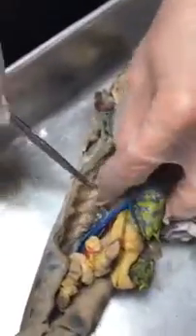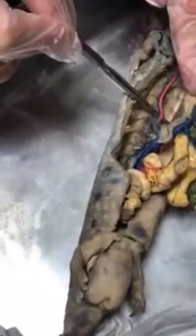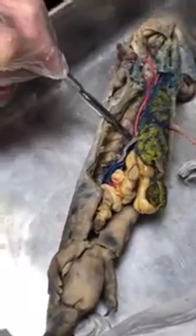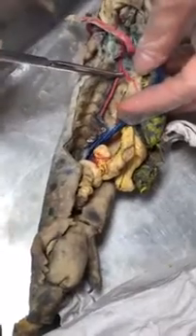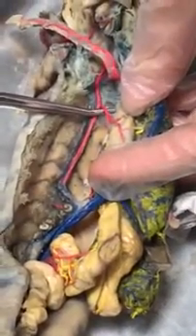Okay, dorsal aorta. And then around either side of the dorsal aorta, the 2 blue vessels are the right and left posterior cardinal veins. So that's way on the bottom, around the dorsal aorta. And then, so this is the liver. This is the stomach. So you can see really easily the one artery going to the stomach. So that's the gastric artery.